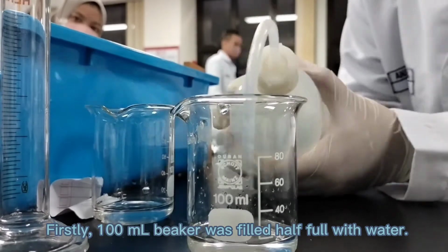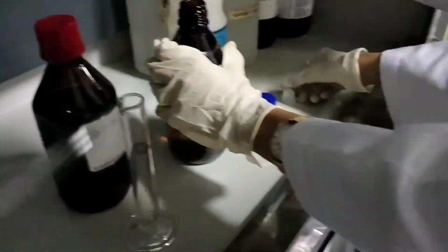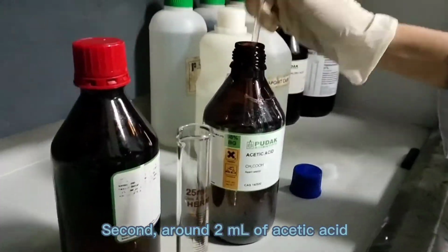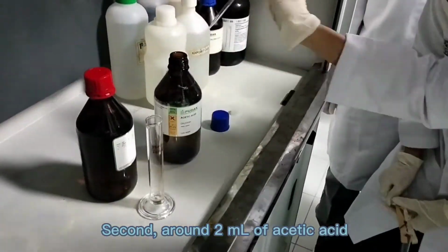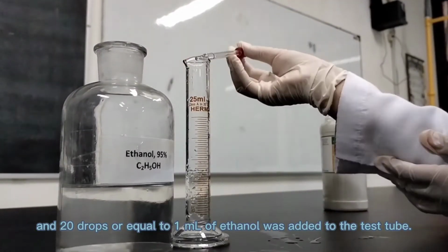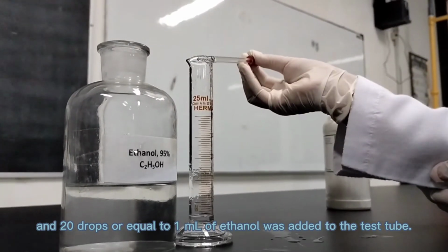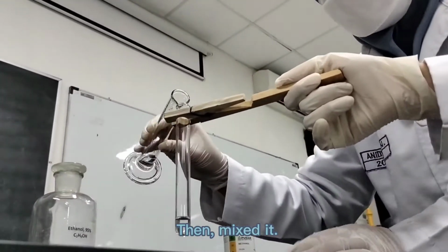Firstly, a 100 ml beaker was filled half full with water. Second, around 2 ml of acetic acid and 20 drops, or equal to 1 ml, of ethanol was added to the test tube. Then mix it.